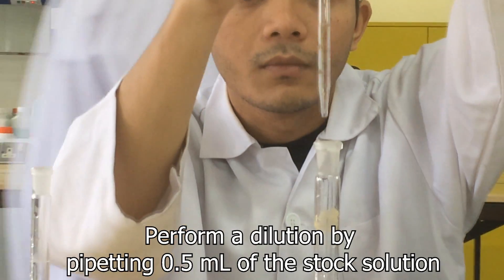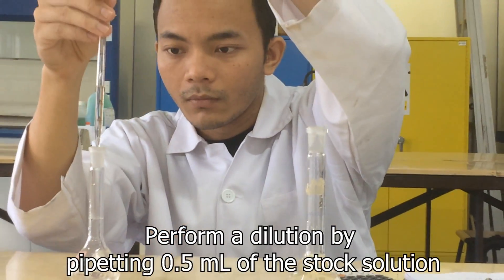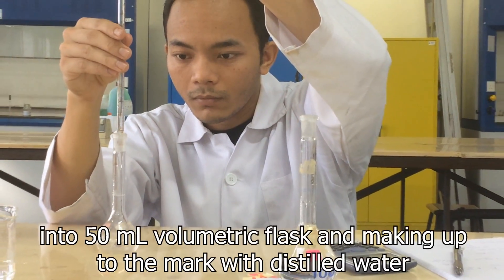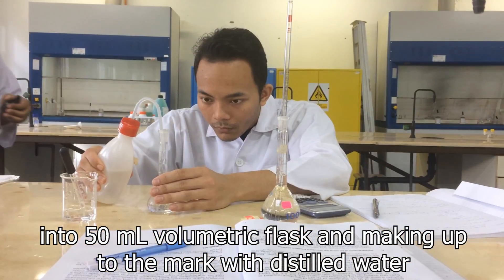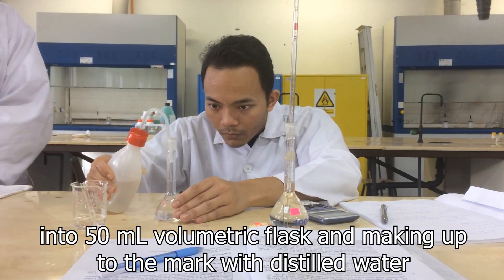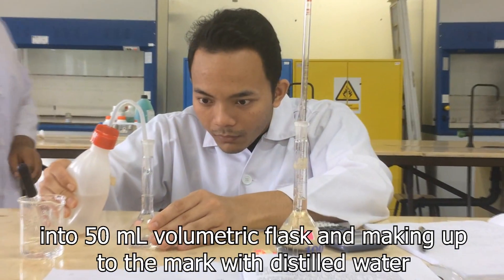The next step is preparation of standards of Zinc for 0.1 ppm. Perform a dilution by pipetting 0.5ml of the stock solution into a 50ml volumetric flask and making up to the mark with distilled water.